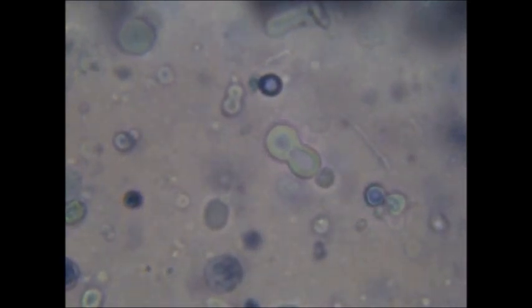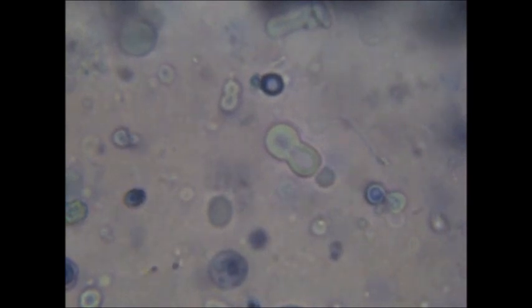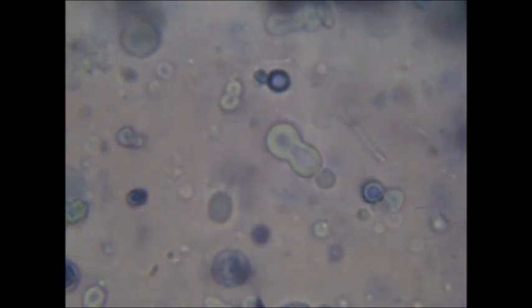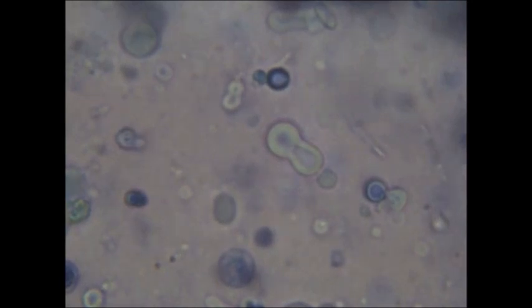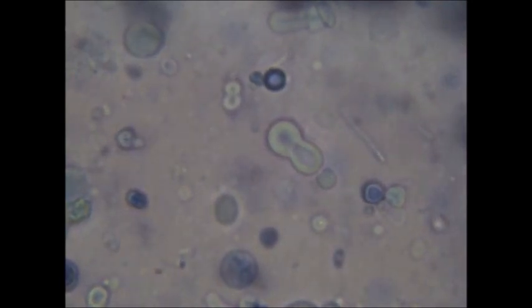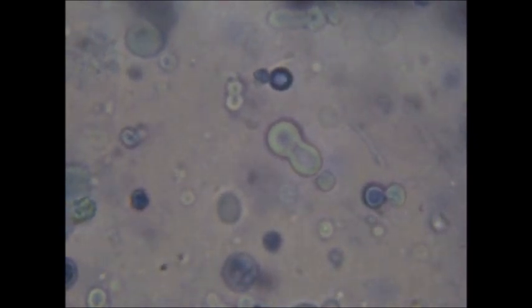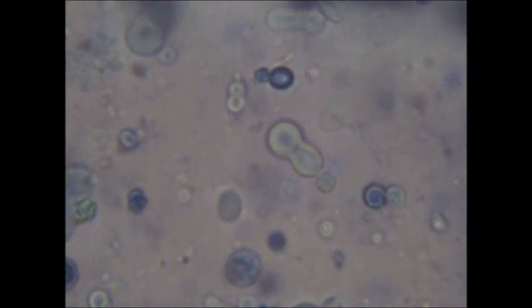So after studying vesicles under the microscope for two hours each night, this is the best that I could come up with. But I believe that it does stir the imagination and prompts one to think about lipid vesicles in the primordial ocean which could have captured strands of RNA formed from free nucleotide bases which in turn were formed from other chemical processes. This could have been how life started on the primordial earth.